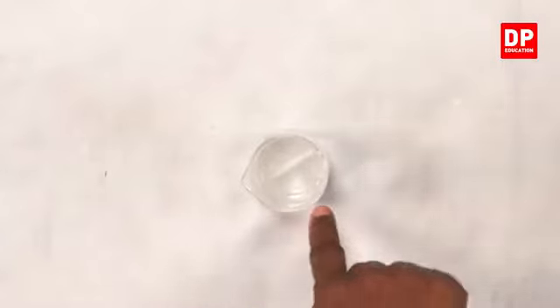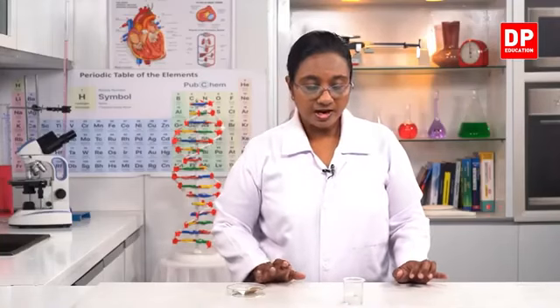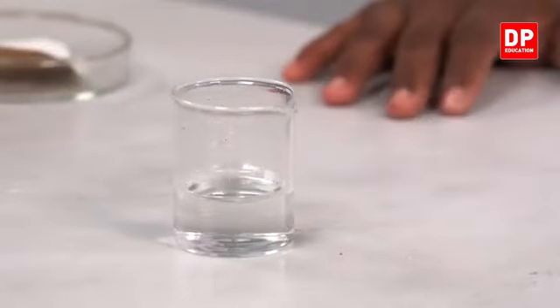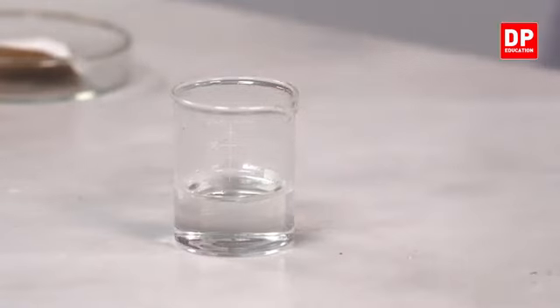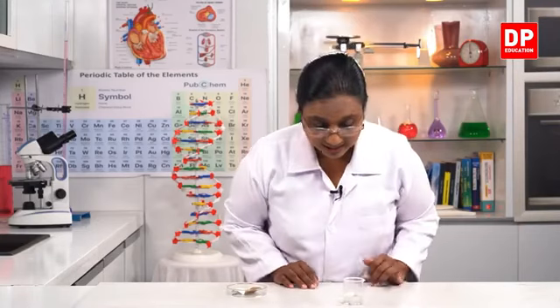And you can see the size of magnesium strip will decrease little by little. So we will have to wait till the reaction is complete. Still you can observe the evolving of gas. So there you see a change where gas bubbles are liberated from the mixture or from the medium. You can say that is the dilute sulfuric acid solution and magnesium, when they are together, you will see the liberation of gas bubbles. Still you can see it occurring.